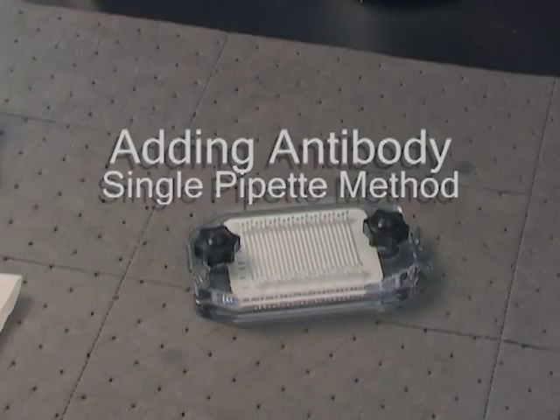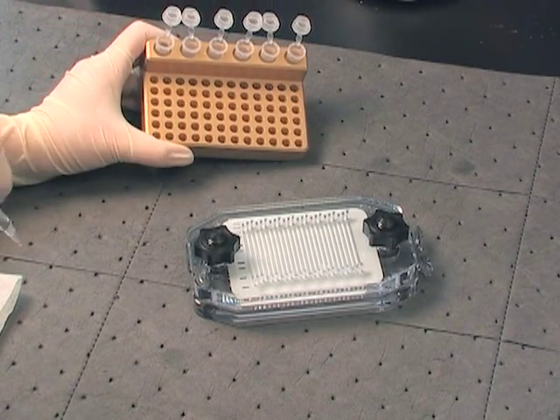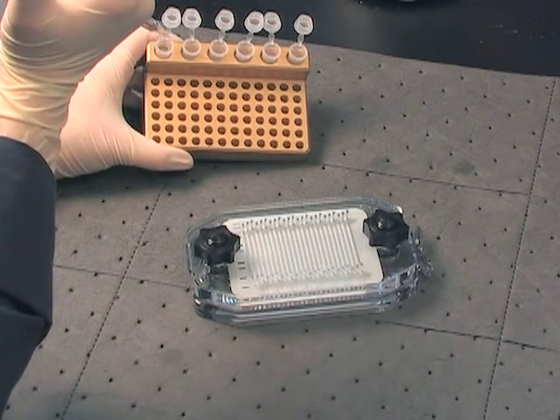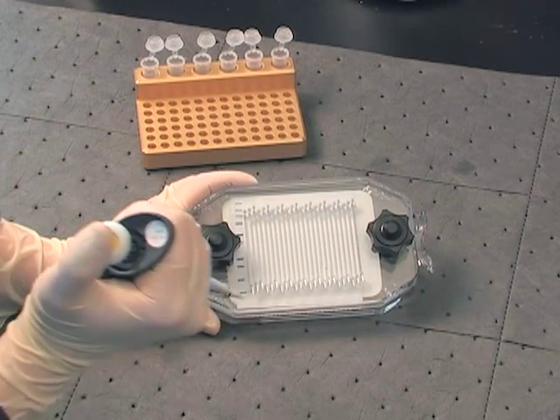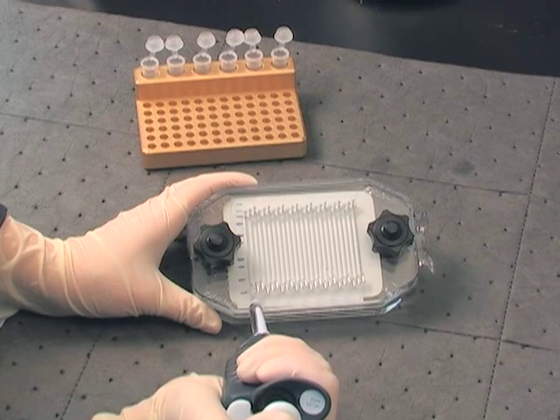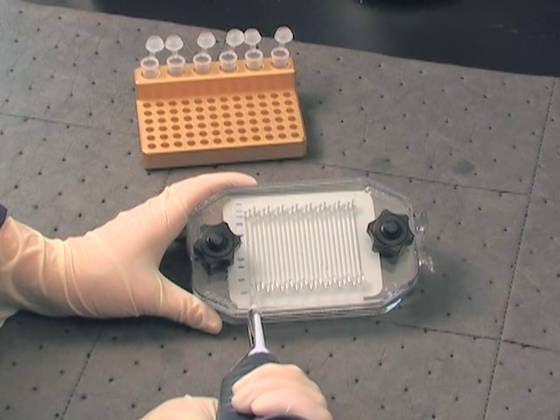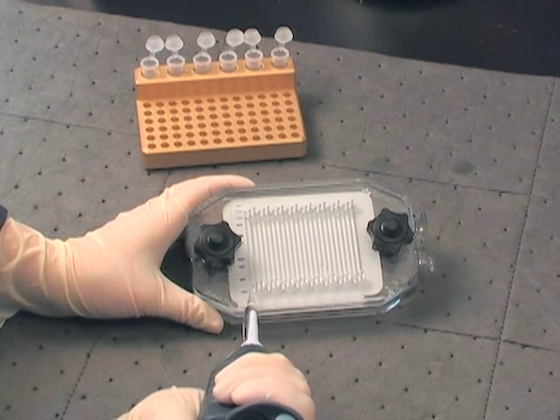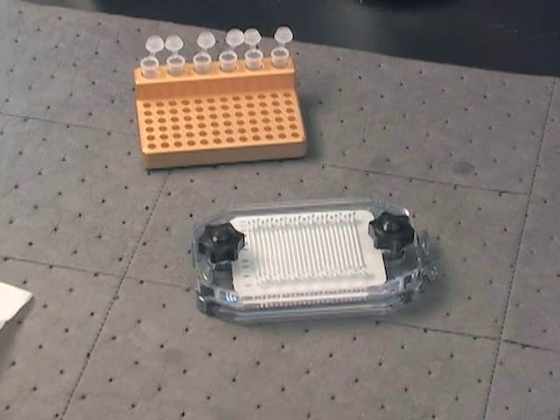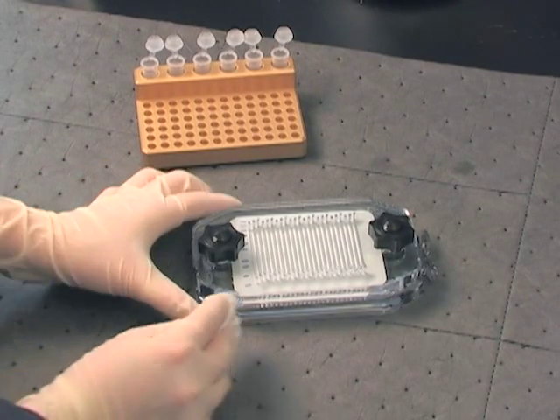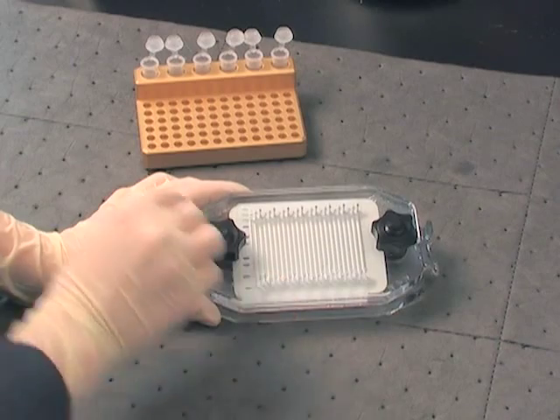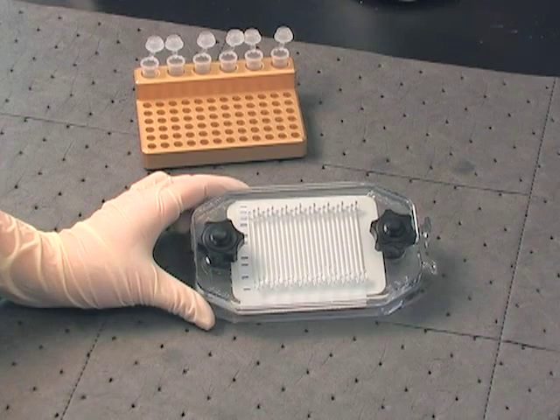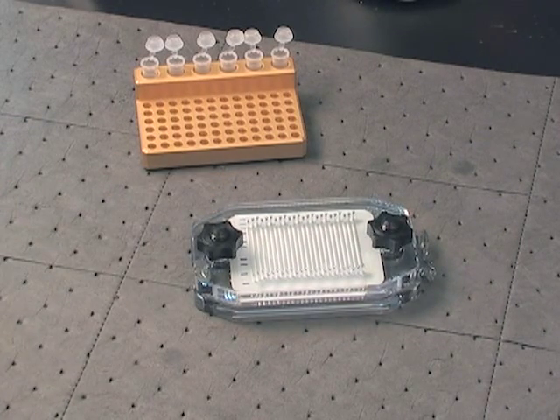Each channel of the MPX holds 160 microliters of reagent. Adjust a single pipette to approximately 200 microliters and fill with diluted antibody. Place the pipette tip into the appropriate beveled channel port and slowly depress the plunger. When the liquid reaches the top and can be seen in the round port, stop filling. Keep the pipette plunger depressed, remove the pipette tip from the port, and finally release the pressure on the plunger. It is important to watch for pooling of reagent around the perimeter of the channel openings. If liquid accumulates, simply wipe it up with an absorbent cloth before continuing to the next channel.